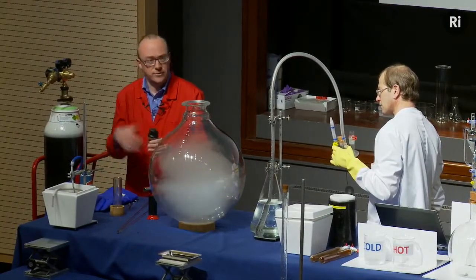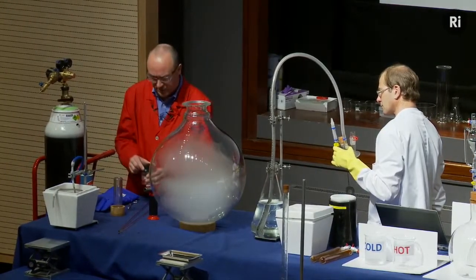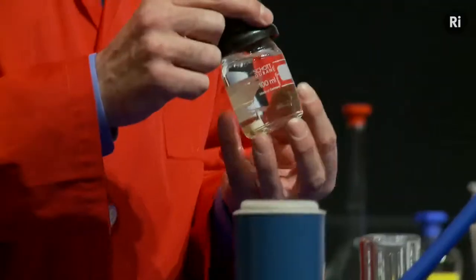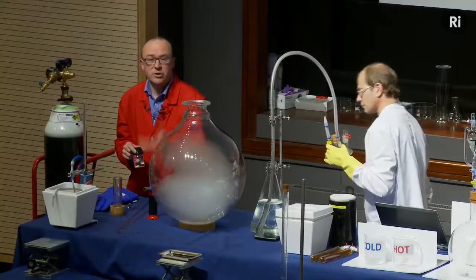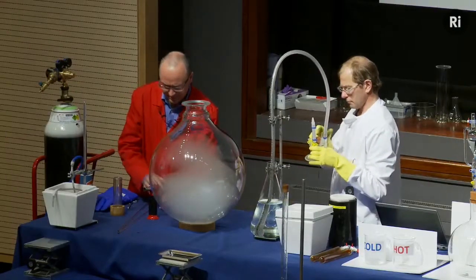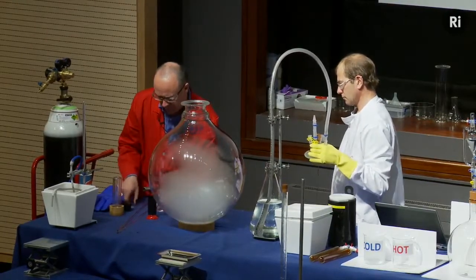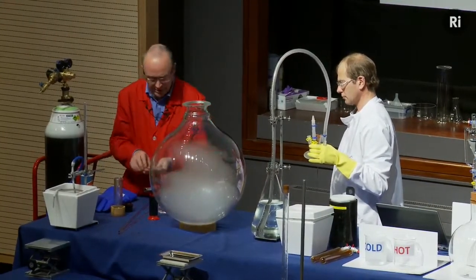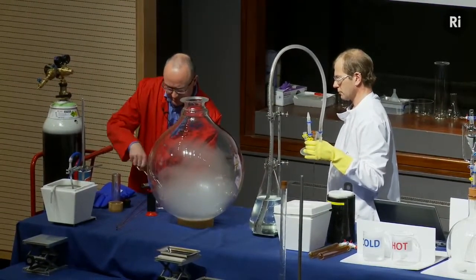There are two kinds of phosphorus, red phosphorus and white phosphorus. This is white phosphorus, it's the more reactive kind. It's so reactive that it actually reacts with the air. If you just leave it sitting on a bench, it will actually catch fire after a few minutes, and so we store it under water. So I'm going to fetch out this piece of white phosphorus, and we're going to put it in a little spoon that's suspended from the lid of the flask.